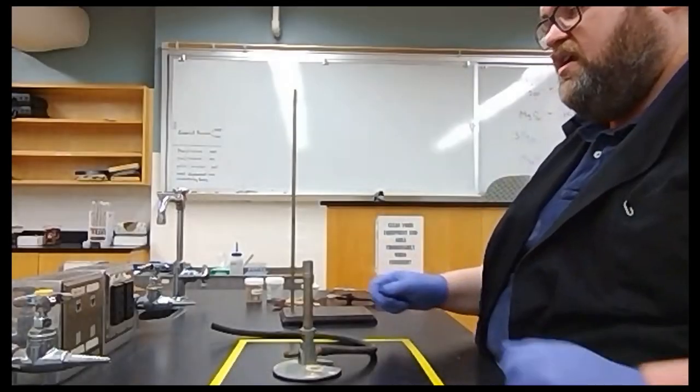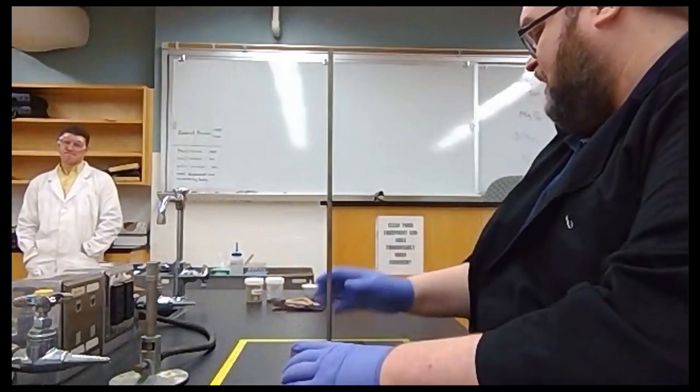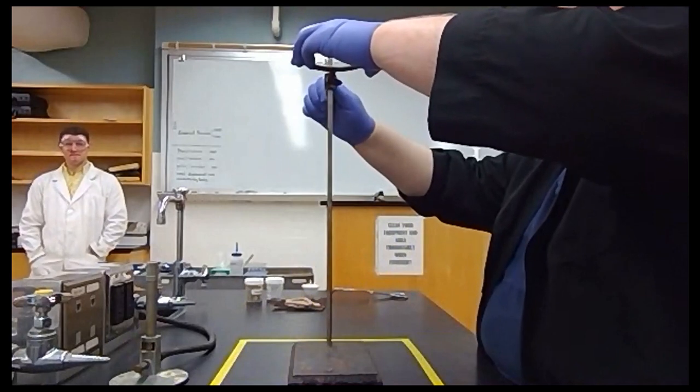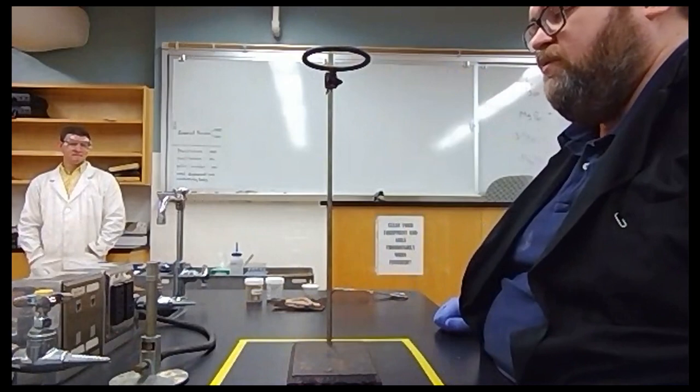Okay, so to start setting up your reaction today, you're going to need to take your ring stand and attach your iron ring. Go ahead and leave it way up top because we're going to light a fire under this, and we don't want this to get warm until we're ready for it.